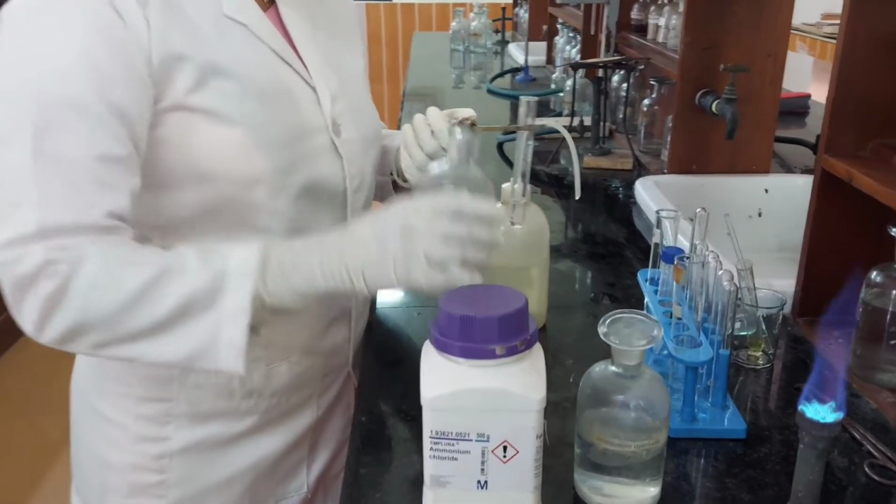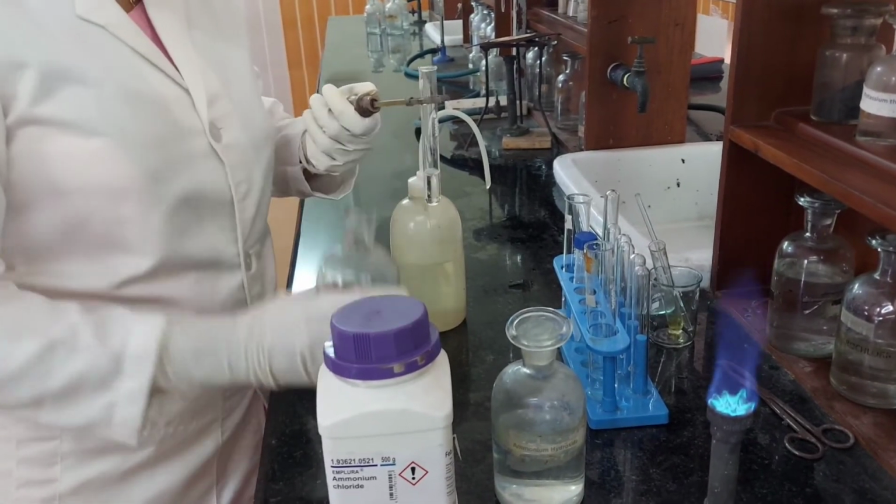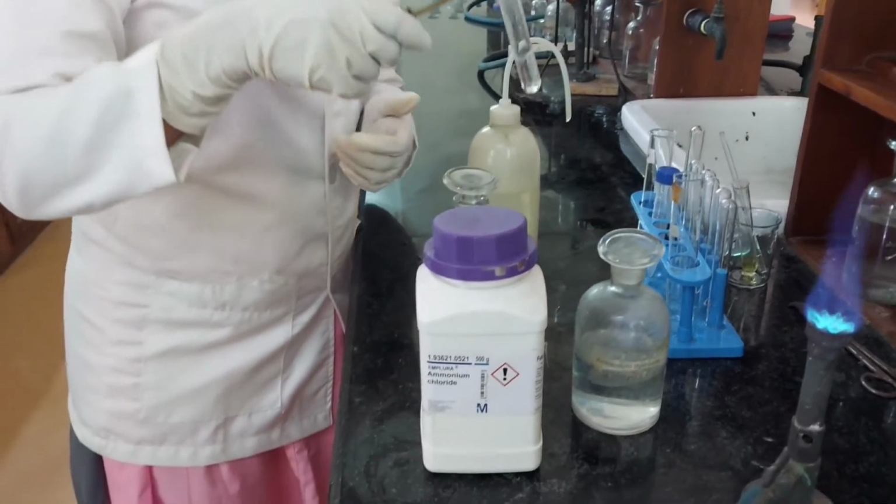Concentrated HNO3 is added. Now this solution is boiled.